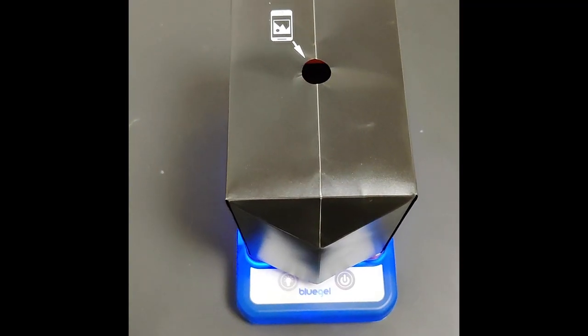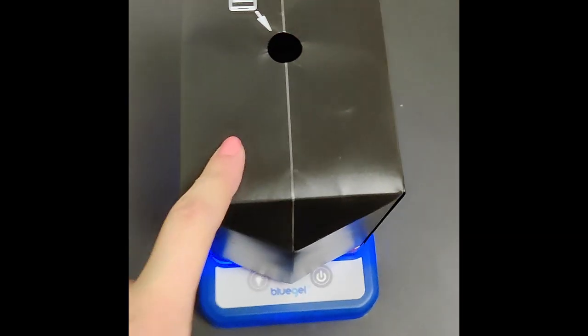To look at the gel, you're going to want to turn the light on and then you're going to put your phone's camera up to this place on the gel and you can see—takes a minute to focus—but I can see that I have some bands and it honestly focuses better with pictures.